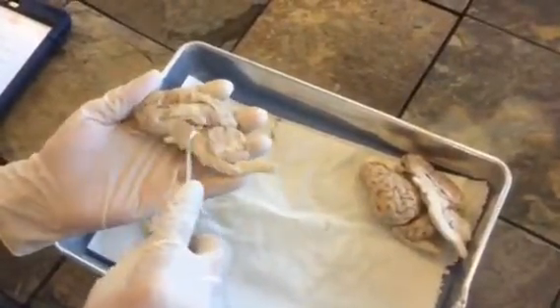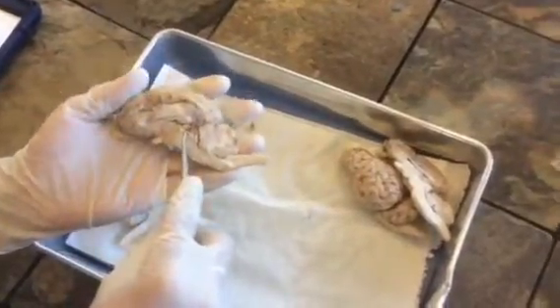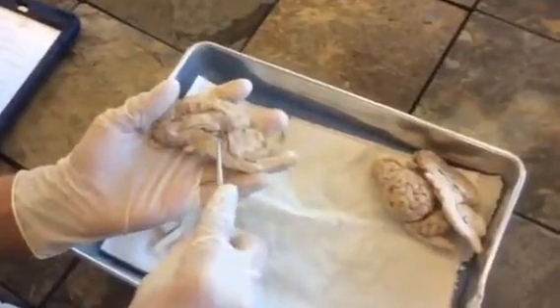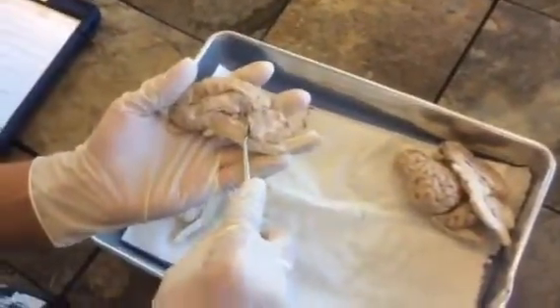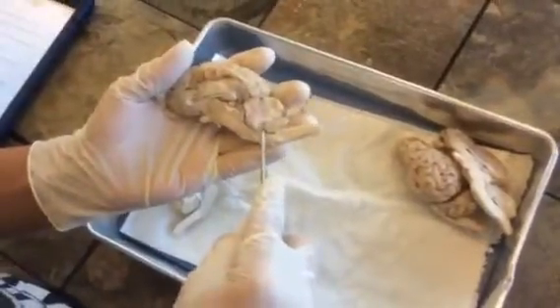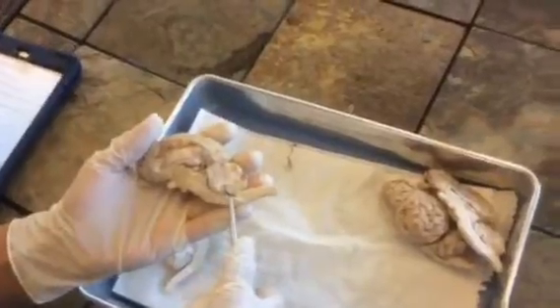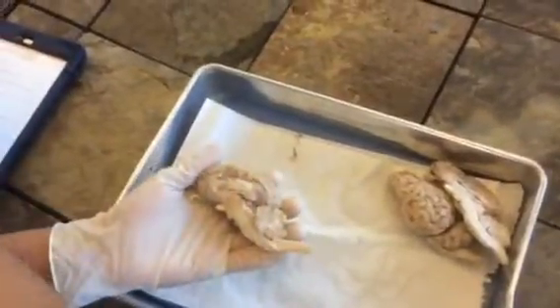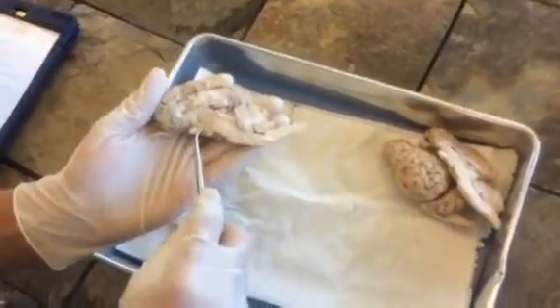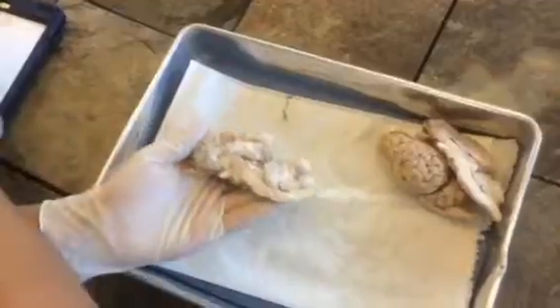And also we have the third ventricle right up here. The third ventricle is filled with cerebrospinal fluid, which basically transports waste away from the brain, and it flows through the cerebral aqueduct. And right here in this little opening, we also have what's called the fourth ventricle. And we also have the mammillary bodies down here. The mammillary body is important for remembering recollective memory.